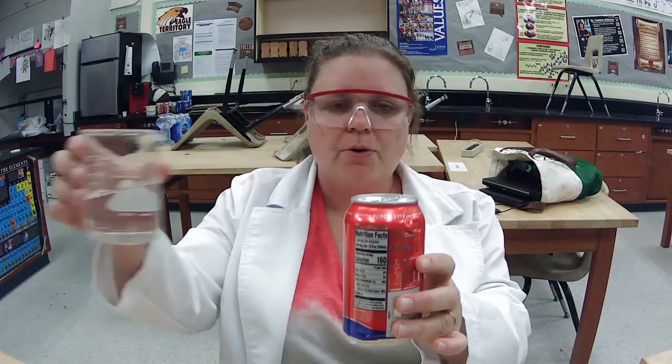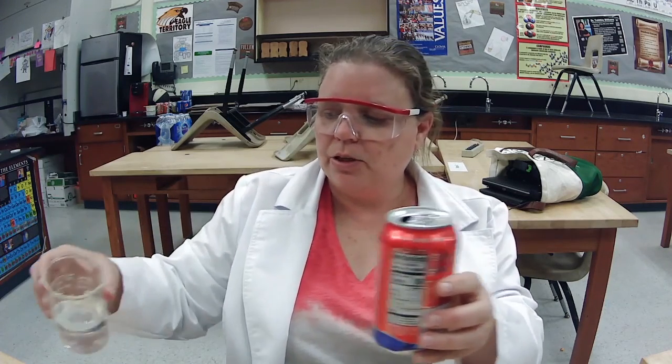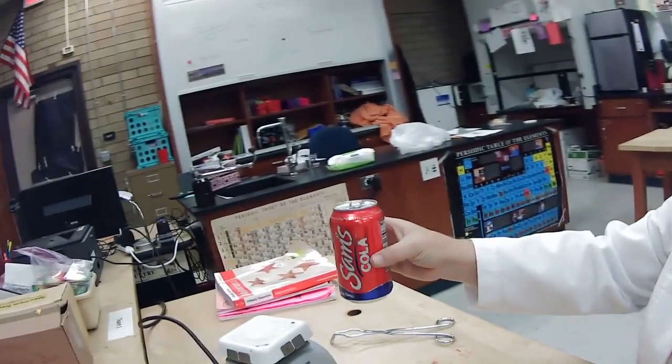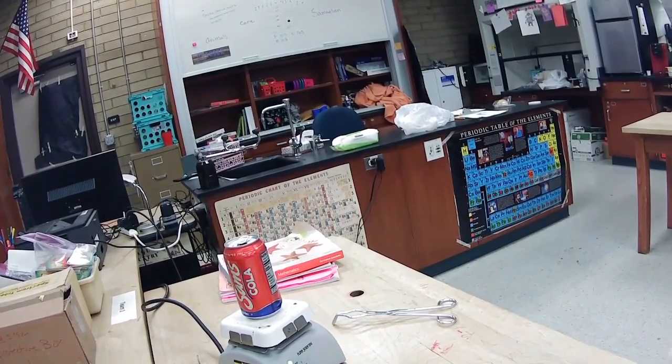All right, so we're going to take a can, and I'm going to pour a little bit of water in it. Not too much because I want it to heat up pretty fast. And then we're going to go over here to our heat source, and we're going to put that on there, and we're just going to wait a minute so that it starts steaming. So we'll just let that heat up.